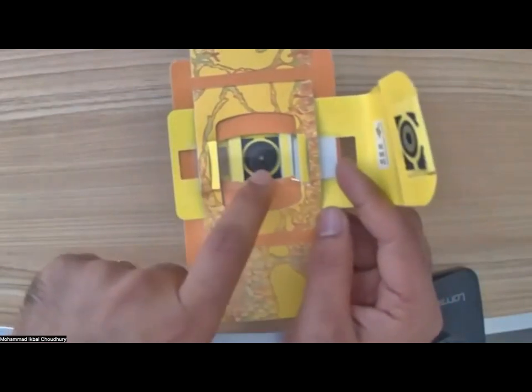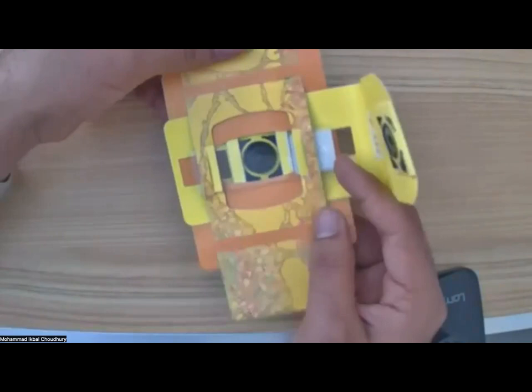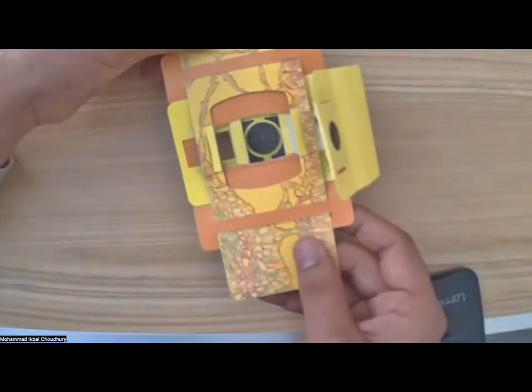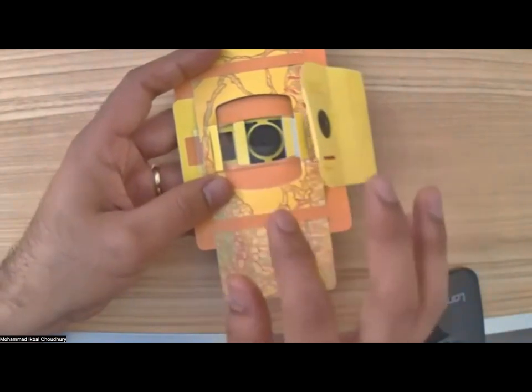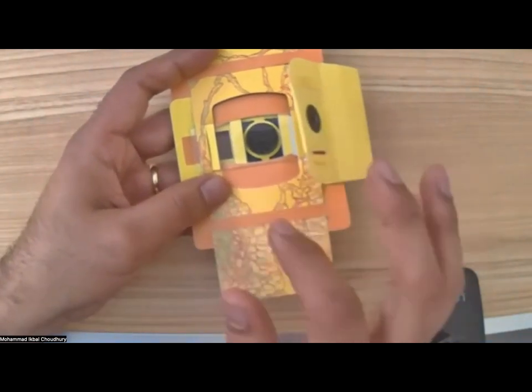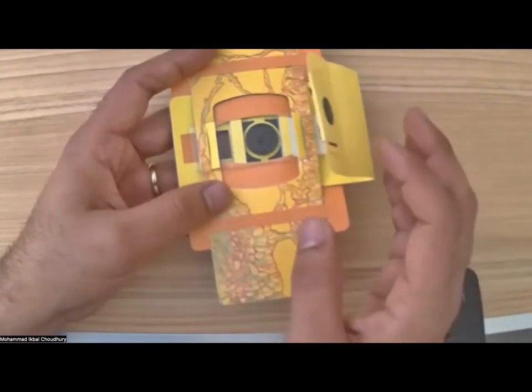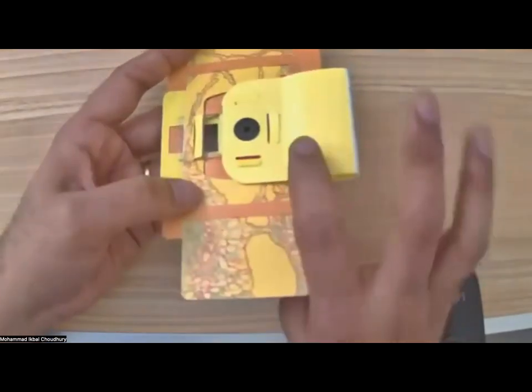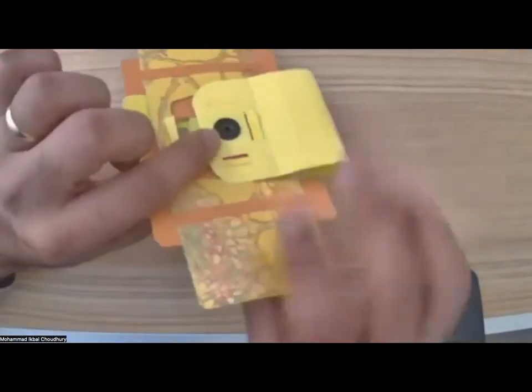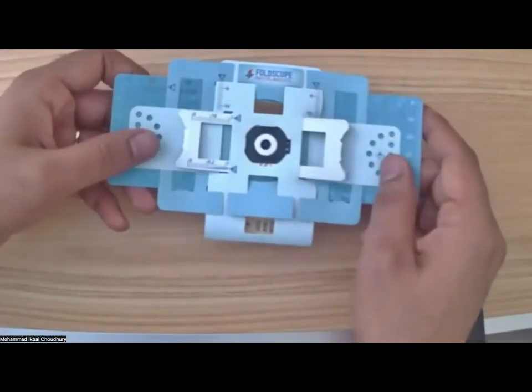So I hope you can see the sample there. It's a darker stain on the glass. So what I'll do is I'll move the lens right onto the sample so that it's easier for me to find it later, right? So I can see the sample, I placed it there. And now I can just snap the flap back, the outer covering. So now the sample is in position, and now it's time for us to visualize.